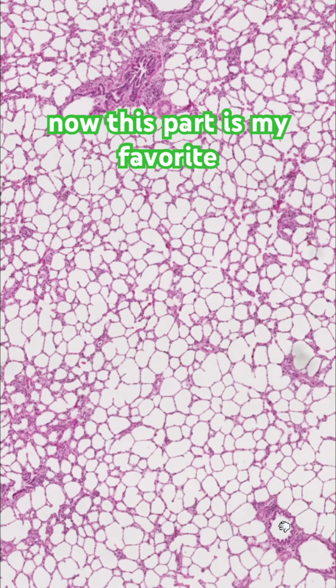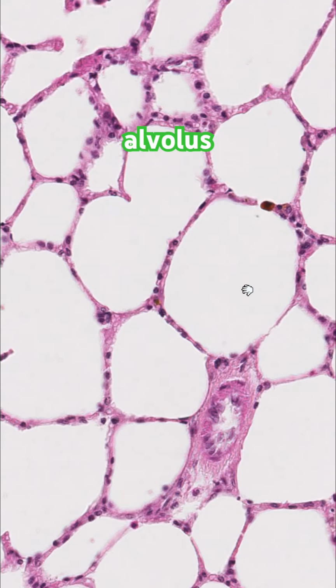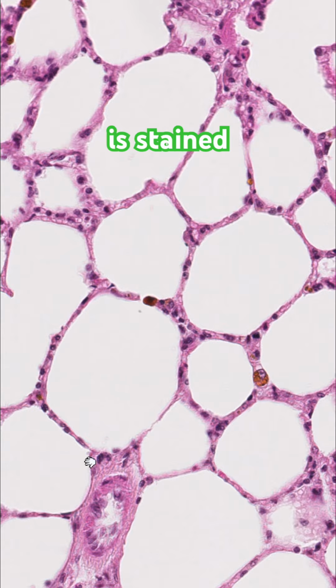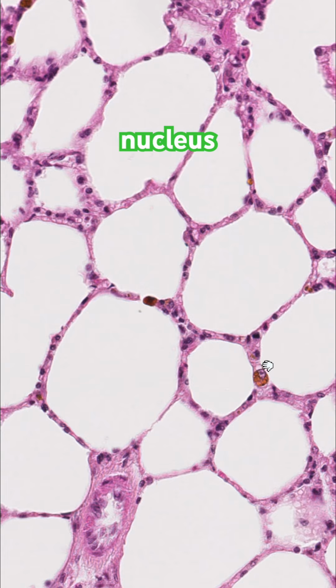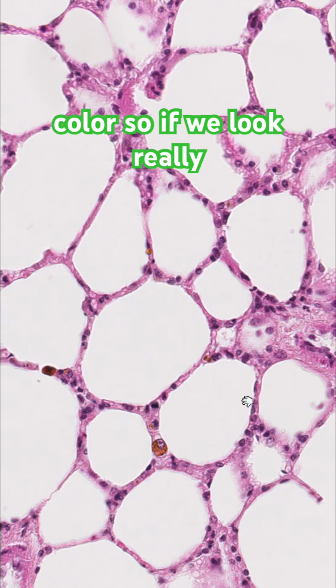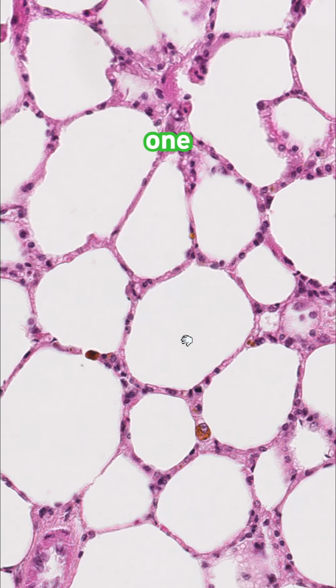Now this part's my favourite part, so zooming in, we can actually see individual alveolus. Massively different to what a textbook would look like. This is stained with H&E, which is a pretty universal stain, so light pink cytoplasm, dark pink purple nucleus, but it stains blood a kind of red orangey colour. So if we look really carefully, we can see that network of 1 cell thick alveoli, and we can actually see how delicate this tissue is.